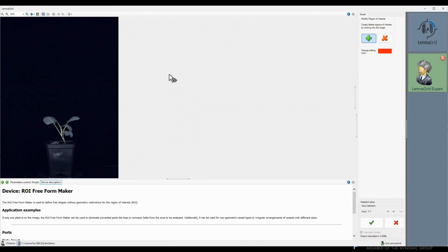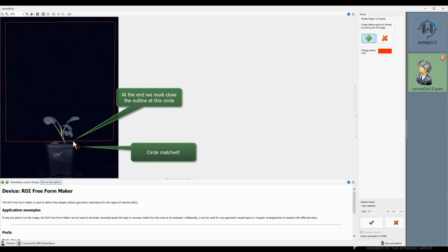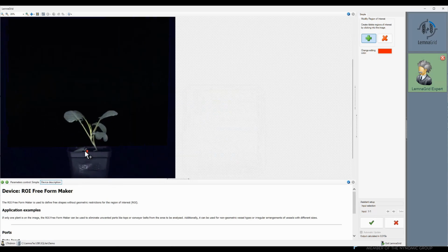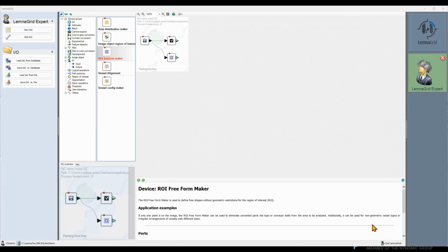So I will mark the allowed region for the plant. We need to give this region a name. With the help of the logical operations device, we now can eliminate all parts outside the marked region.